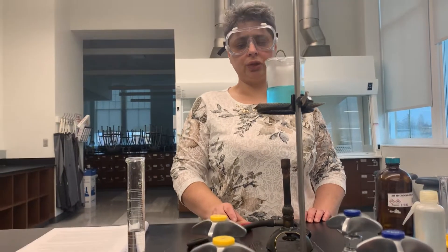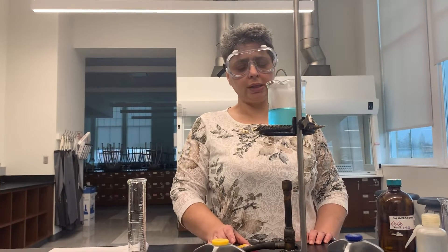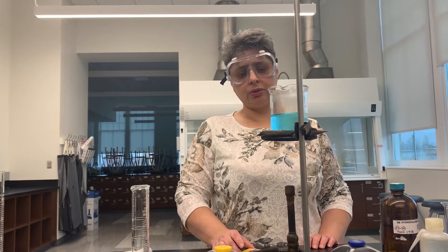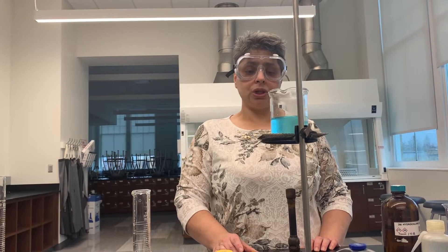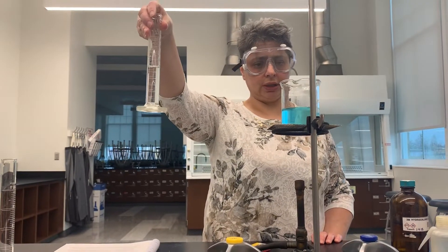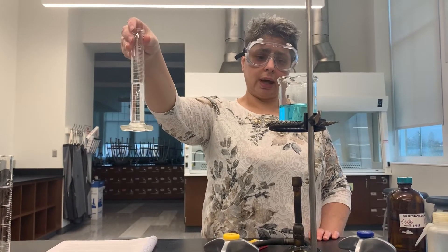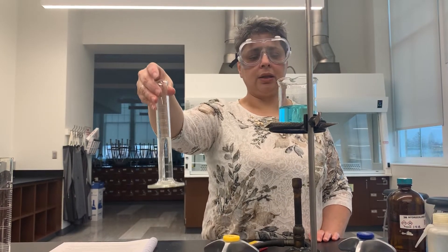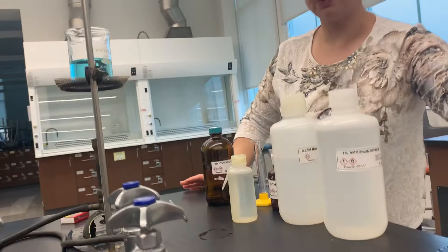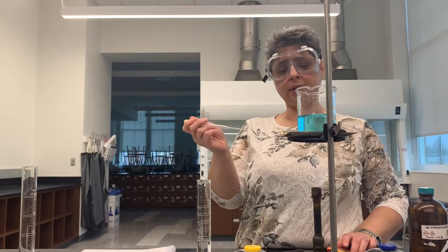What we want is for our solution to heat until it's either almost boiling or gently boiling — we don't want it to boil crazily or jump out of the beaker. The next step is to add our barium chloride. I have 30 milliliters of it measured in this graduated cylinder, just like your procedure recommends. But I don't want to add it until the solution is hot, and I will be adding it dropwise using a pipette I've prepared.